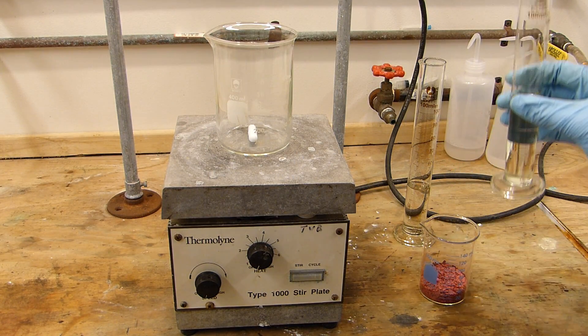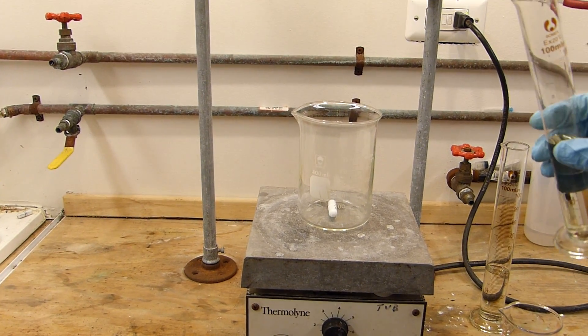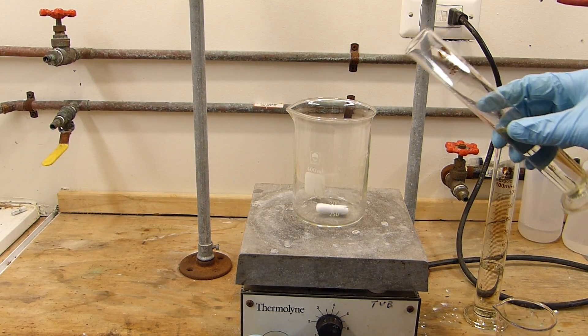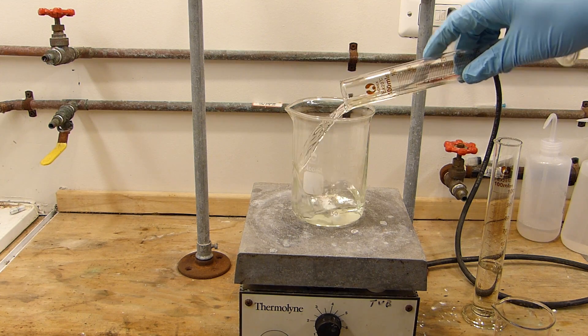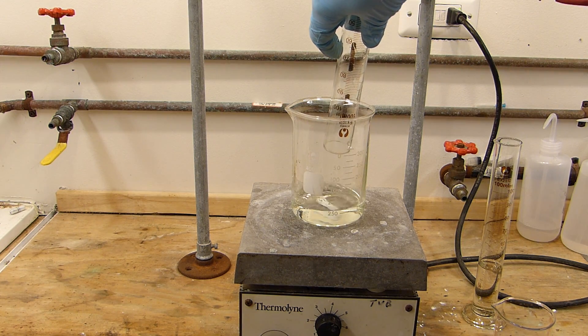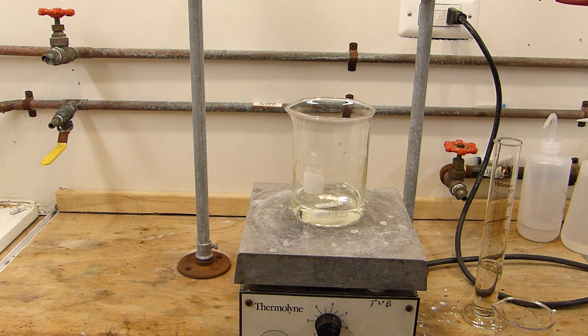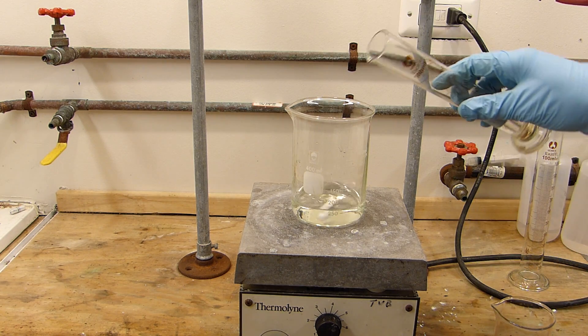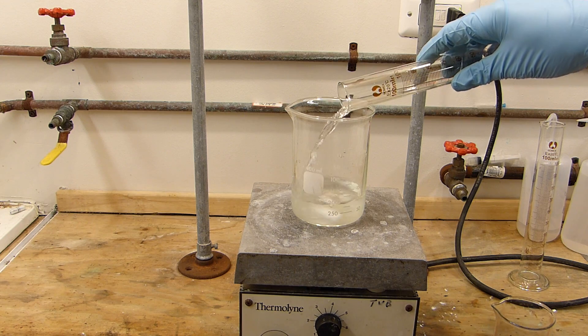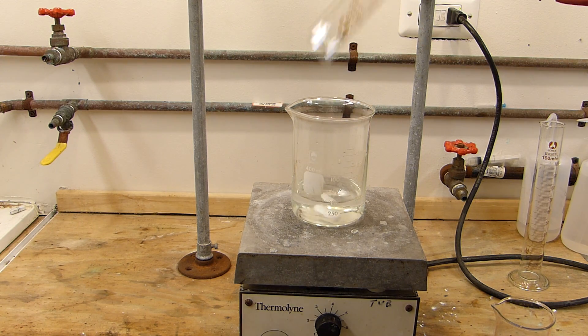So first the HCl into this beaker with some stirring. Just remember of course add the acid to the water. HCl doesn't make too much of a difference but it's a good practice anyway.